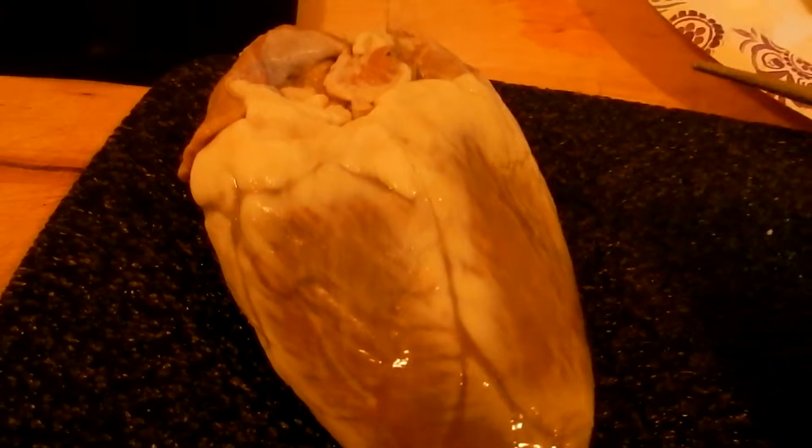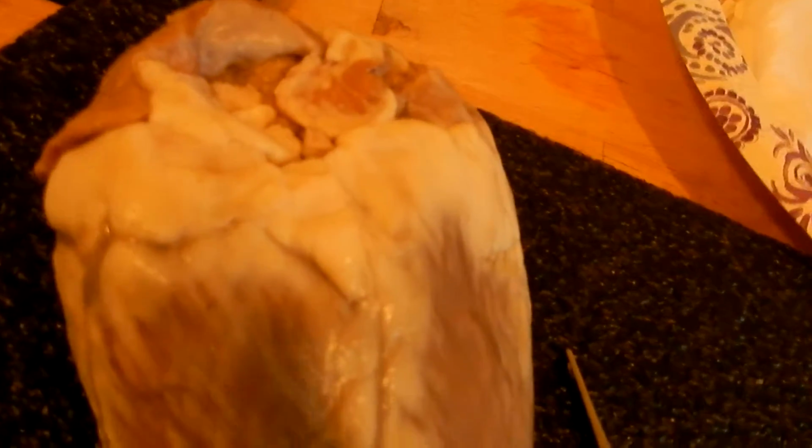And the whole point of the aorta, it's the largest artery, and it collects the blood from the left ventricle and delivers oxygen. When it's collecting that oxygenated blood, it sends all that blood to the organs, the muscles and the tissues of the body. So it's pumping, and it's very important that we get all of that blood. That's why you always hear people speak about the aorta and how important it is, because otherwise we wouldn't get oxygen to the extremities of our body.